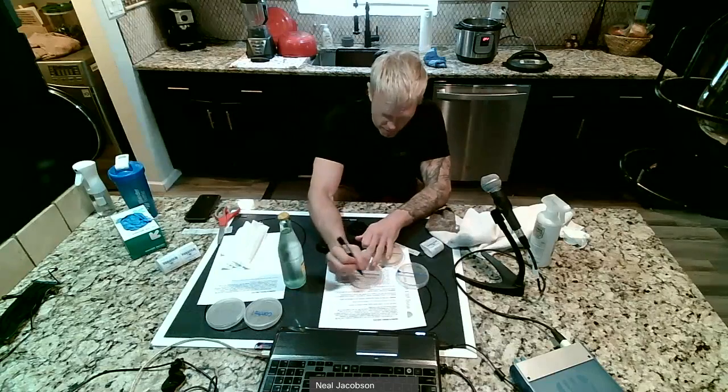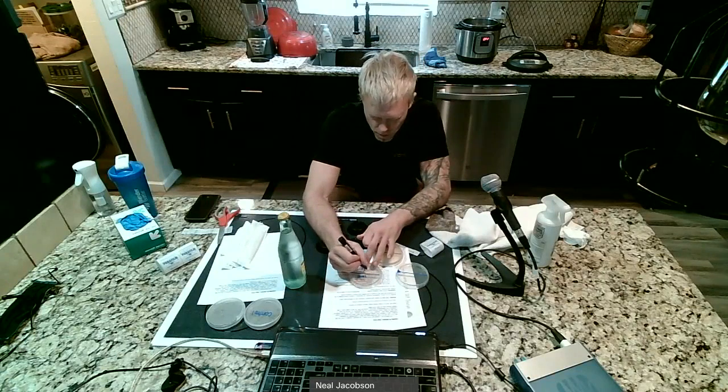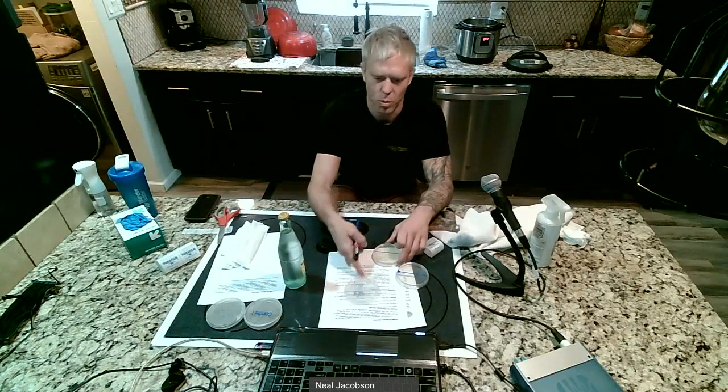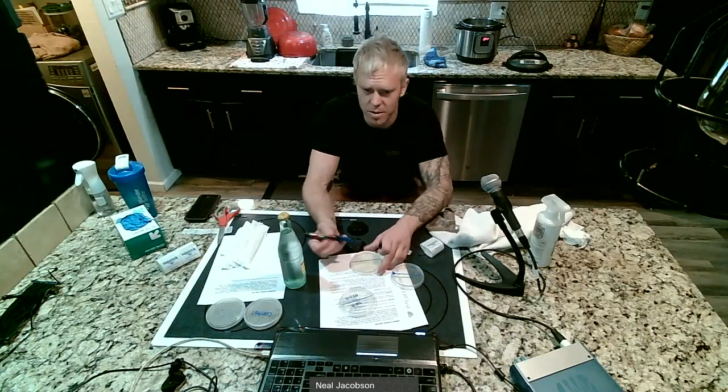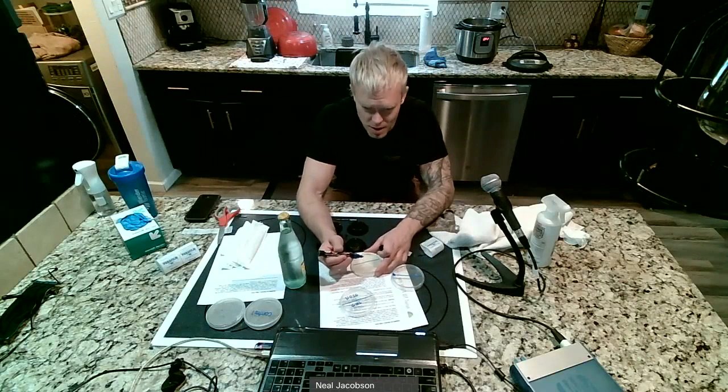So I'm going to write backwards. I'm going to write ear, and nose. Oh, oops. That's going to be one test. And we're going to compare them all together too. So we're not just comparing ear and nose, but on the same plate, it makes sense.